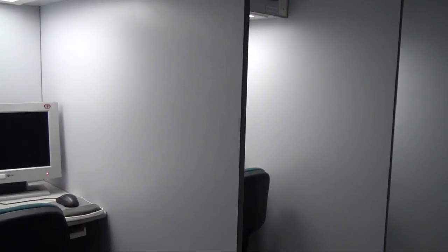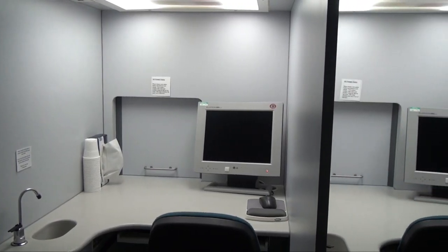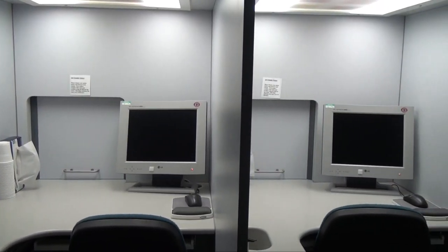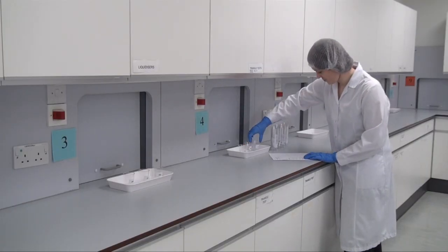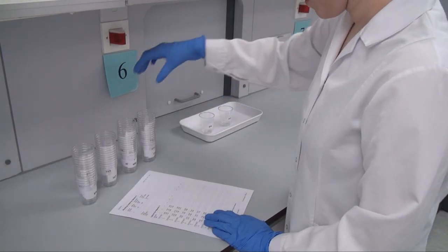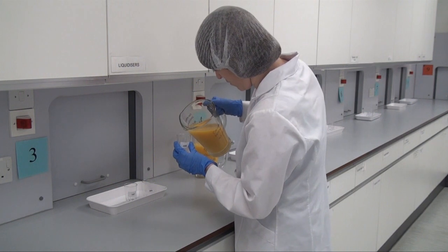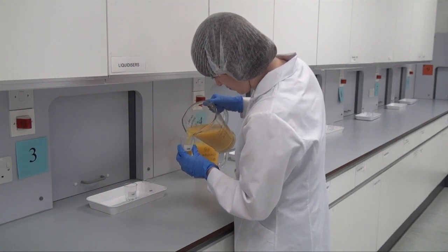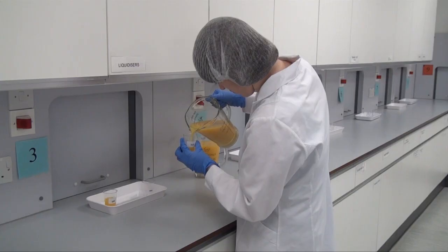Care is taken to ensure that each product sample is prepared and presented in a standardized and consistent manner, to ensure that no sources of bias are introduced which could have a negative impact on the end test result. The triangle test is principally used to determine whether a sensory difference exists between two products — for example, to test whether a change to a product's ingredient, process, or packaging has had an impact on its overall sensory properties.